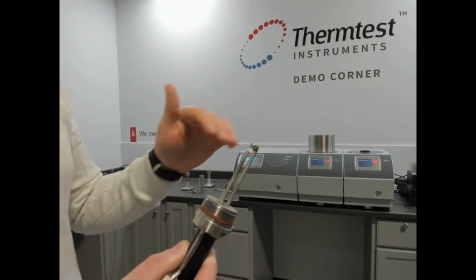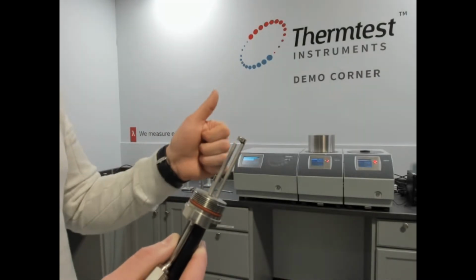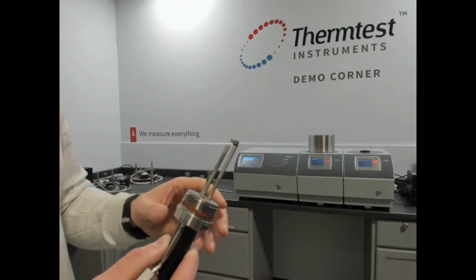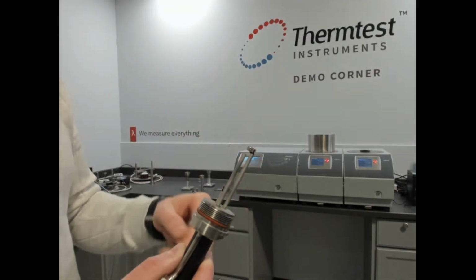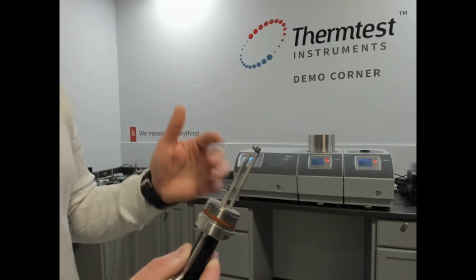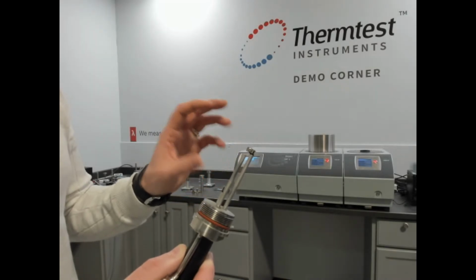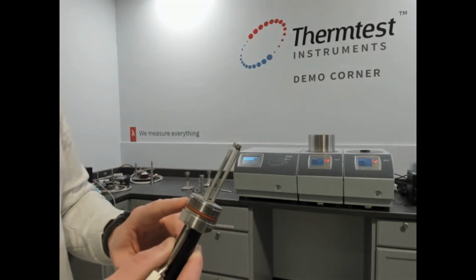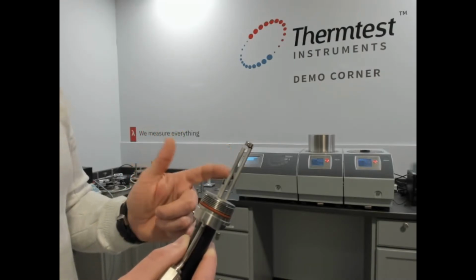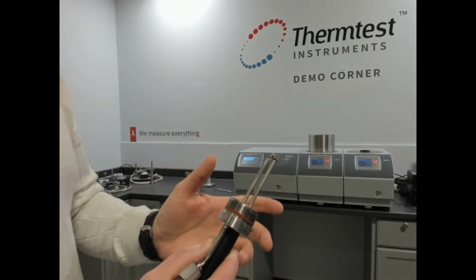So if you're only testing within a temperature range where you don't have convection due to temperature rise and or the ambient temperature, you probably don't need to pressurize it. But as you go near boiling points or evaporation of your fluid, you might need to back pressure it to allow you to test and keep the fluid in the liquid phase. The 2 back pressure ranges are 20 bar and 35 bar. Those are the 2 pressure ranges you can use to really extend the use of this sensor.